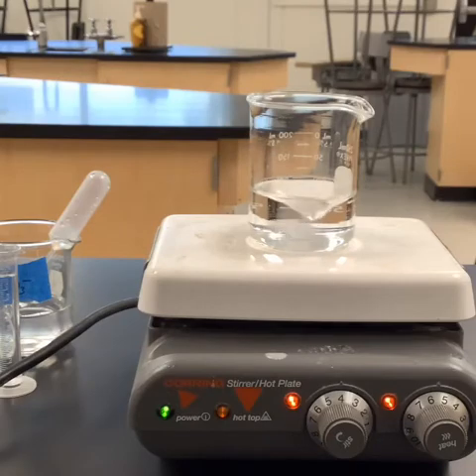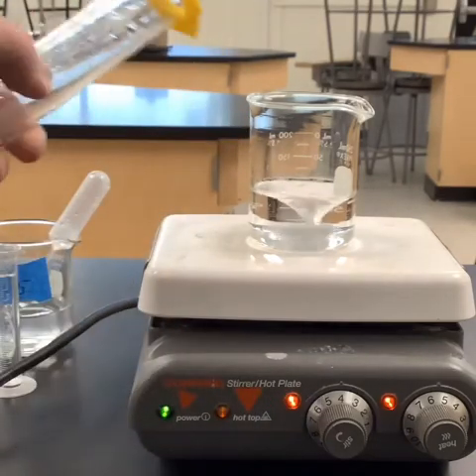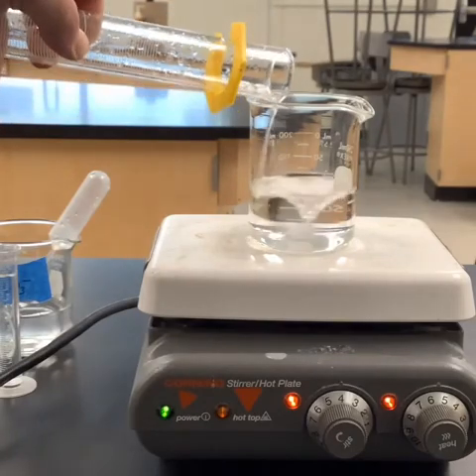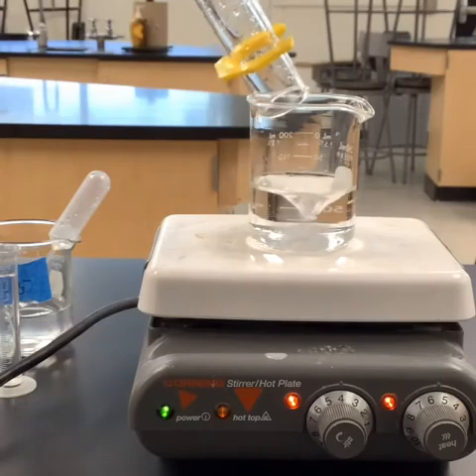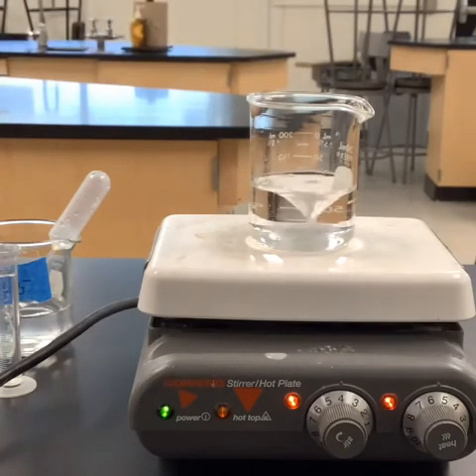We are gonna go ahead and pour one of them in. So I'm gonna pour the iodate in next, but once again, we don't have a chemical reaction yet because we haven't added our other reactant. So now, this is where it gets tricky. We have to keep things constant, right? So we have to make sure we start timing in every trial at the same point.